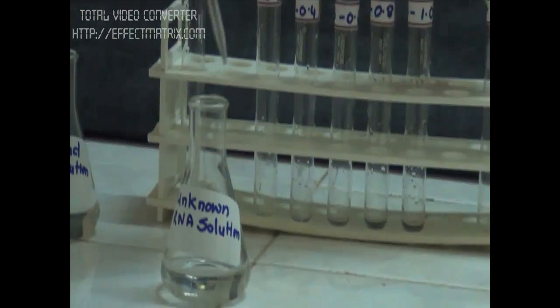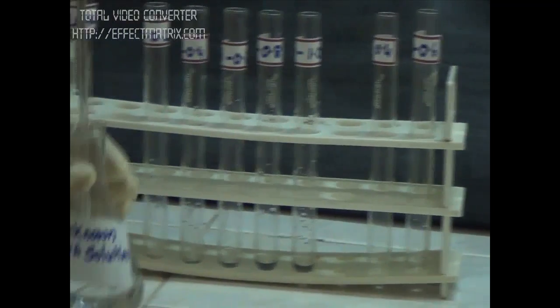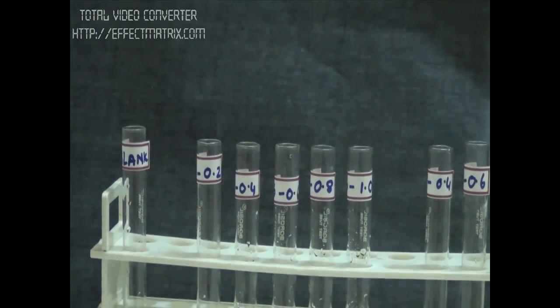Now we will take unknown RNA solution. We are taking aliquots of 0.4 and 0.6 ml. So now we have filled the aliquots.